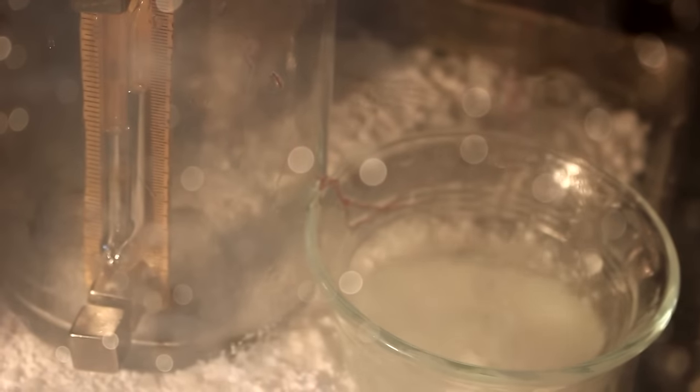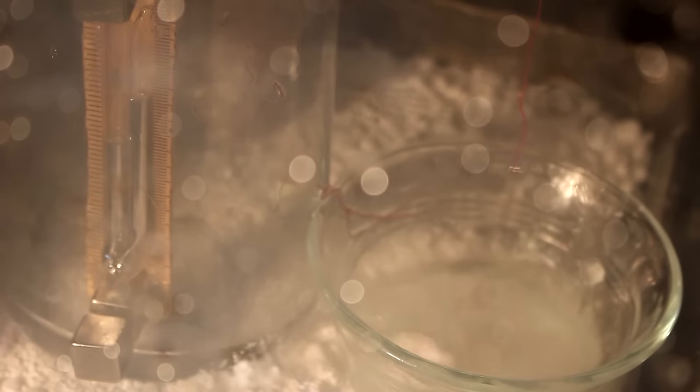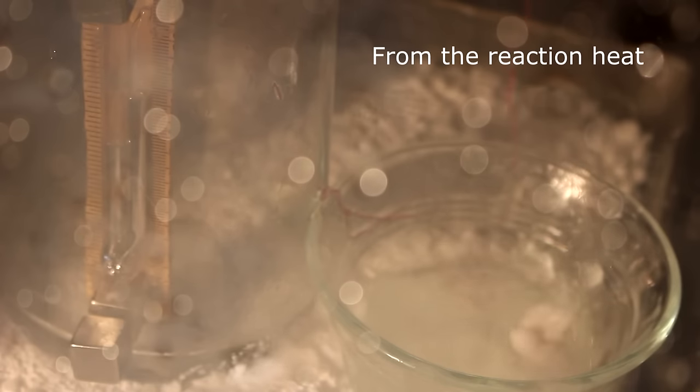And this is a piece of sodium. So it doesn't react quite as quickly. I'm surprised it actually didn't melt the sodium. Normally when you put it in water it melts.